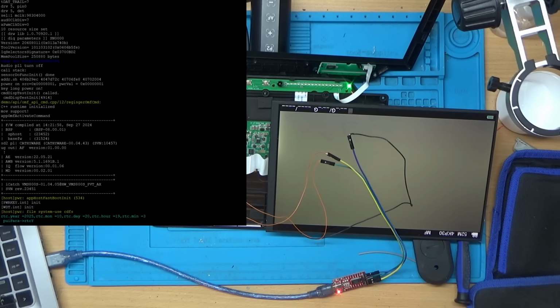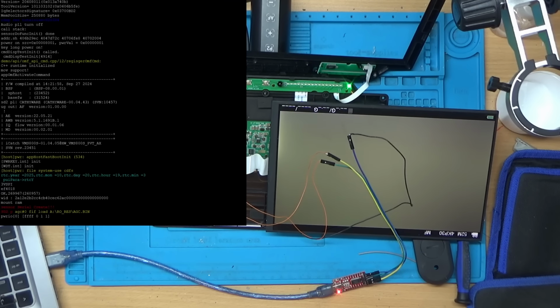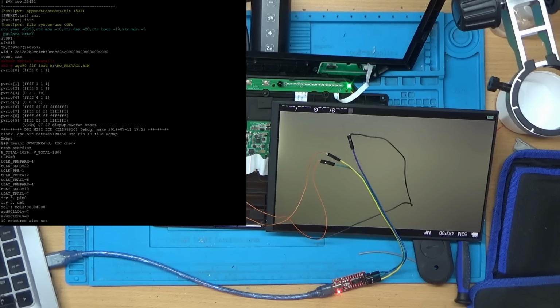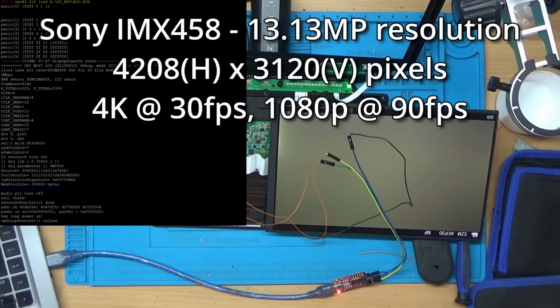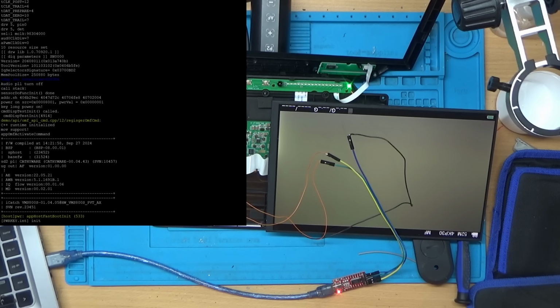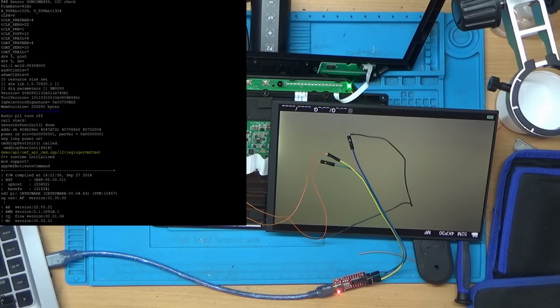So what can we see here then? Can we see anything interesting or any errors or anything? I've just noticed something here, Sony IMX458, so I guess that must be the sensor that they're using for the camera. Let's just see if we can see anything else. There's something there saying audio PLL turn off, so I'm not sure what that's about. But apart from that, I don't think it's really telling us too much.